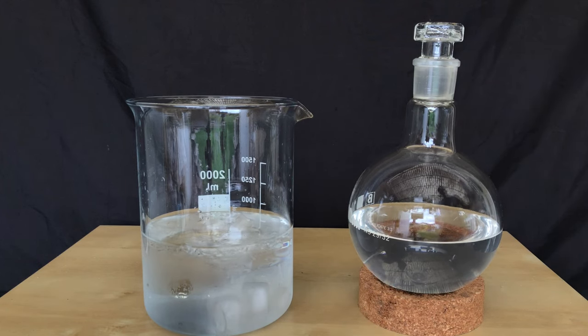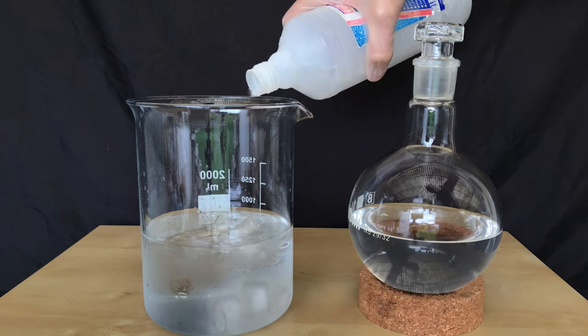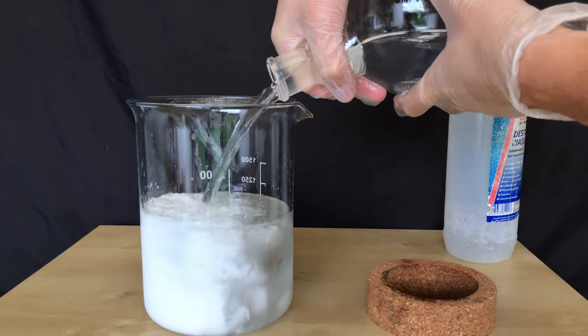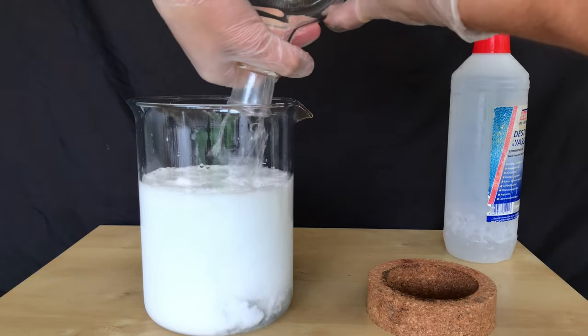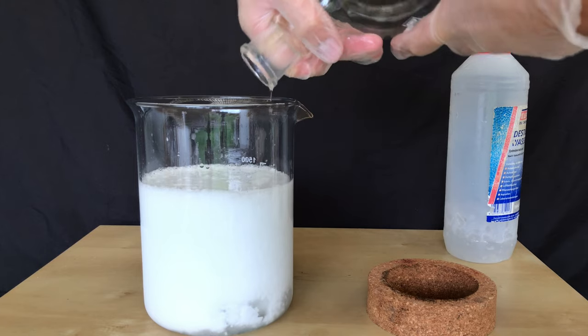The product should crash out while water soluble contaminants will stay in solution. Here is what I mean by this. When the methanolic solution is added all of this white stuff, which is our product, immediately crashed out.